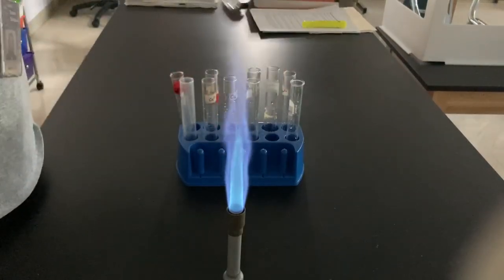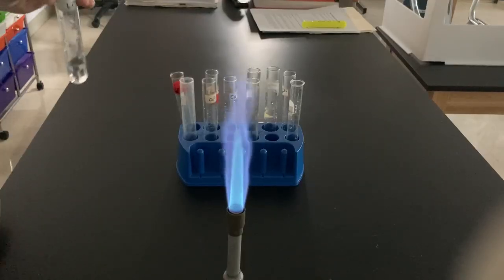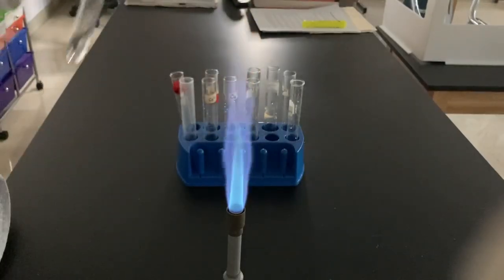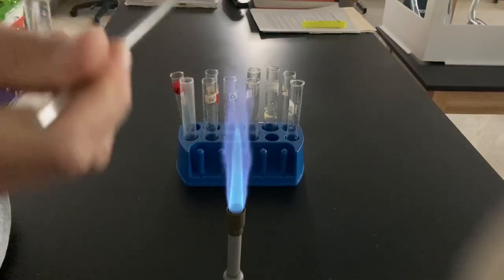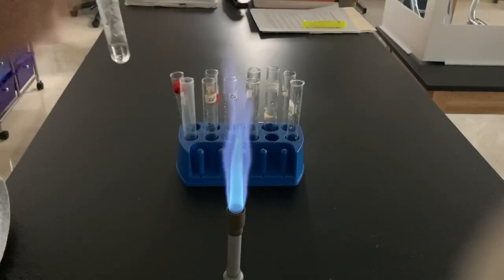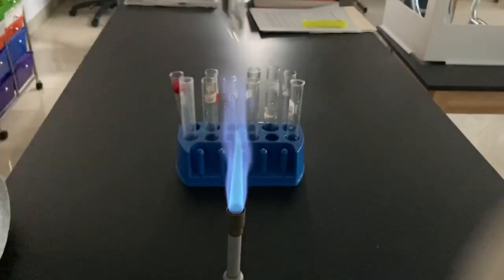And then let's get to lithium. Here is lithium. Not the green — that's copper, that shouldn't be there. I wonder if my nitric acid is a little bit contaminated now. Let's try again with lithium. Yeah, the red color — look at that red there at the very beginning. That is lovely for lithium. That's what we like for lithium.